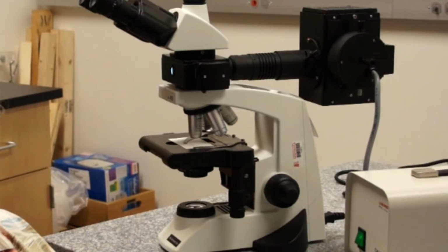We are going to begin our discussion of microscopical principles by using a standard compound microscope. Now, you're probably familiar with dissecting microscopes, which you've used in some of your labs to dissect organisms or other things. That's a very low power magnification instrument, and this is a different instrument. This is called a compound microscope.